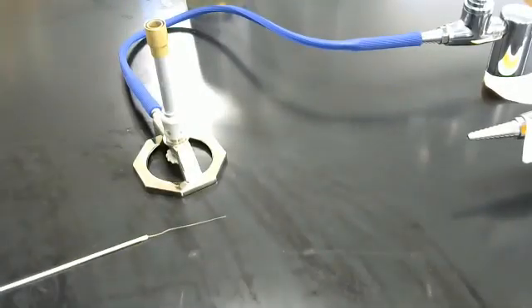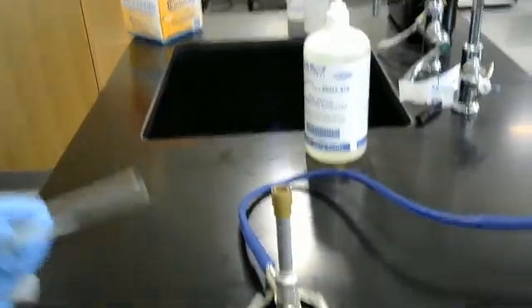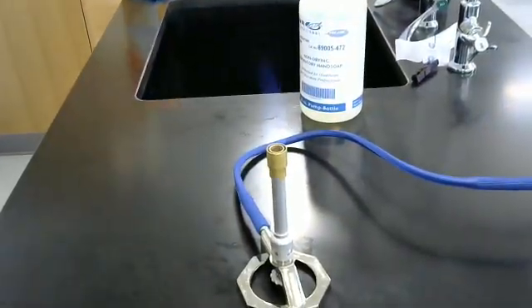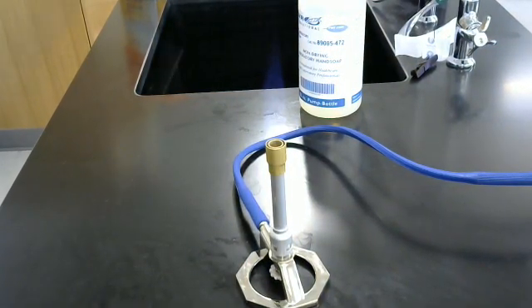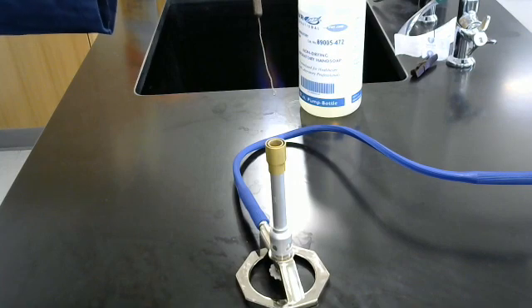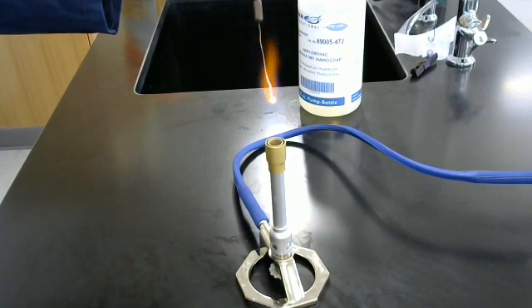Come back over to the fire. One, two, three. Cap it. You are good to go. Then, sterilize.